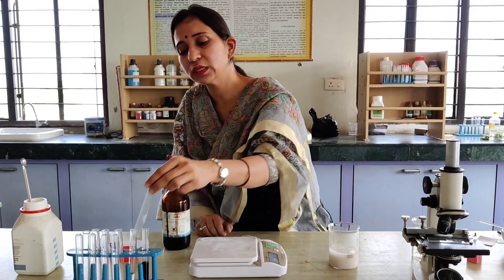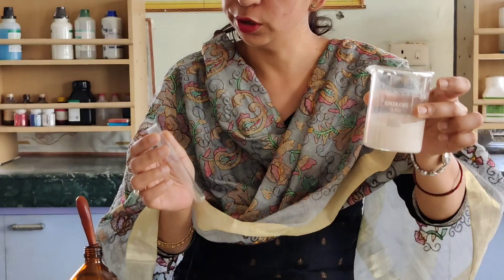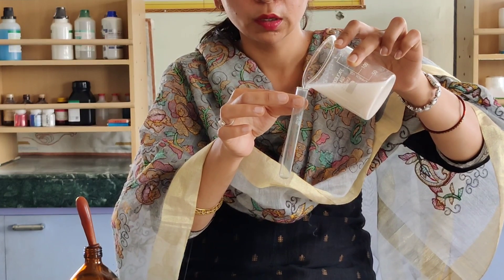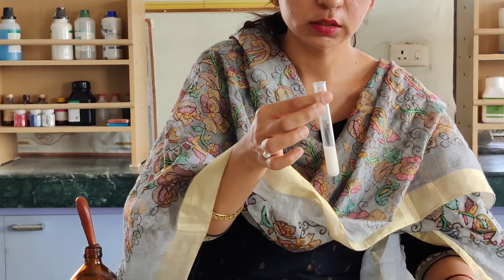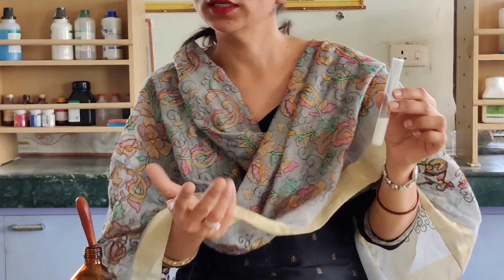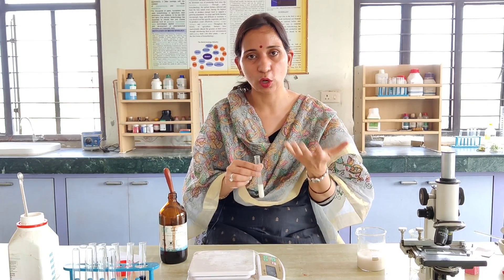Now we have to show the effect of salivary amylase. We take the starch solution again in a test tube. To the starch solution we will add salivary amylase, which you have to extract from your own saliva. To stimulate saliva production, you can imagine a delicious food so that saliva secretes in your mouth.